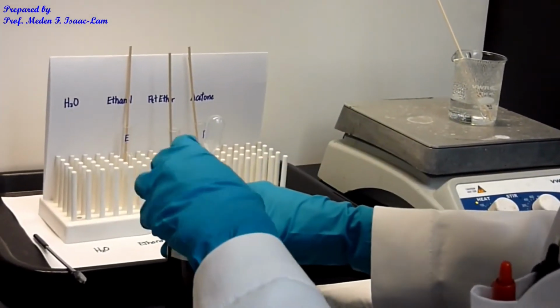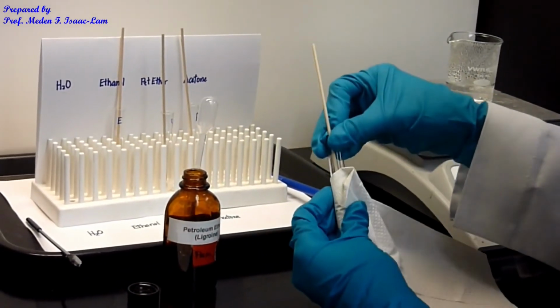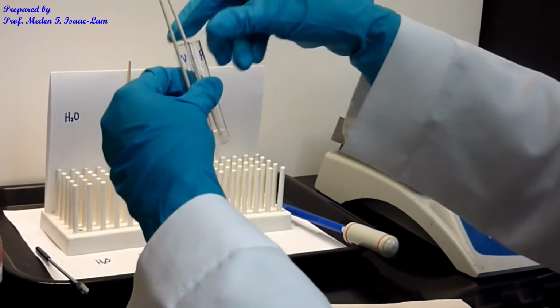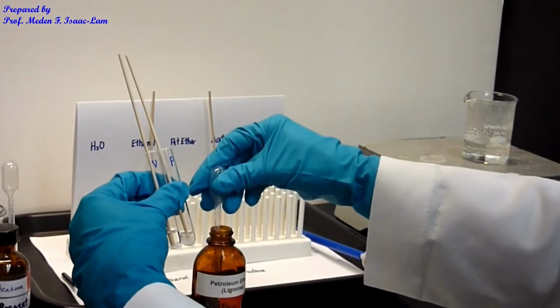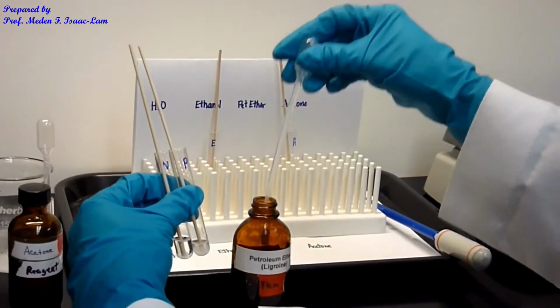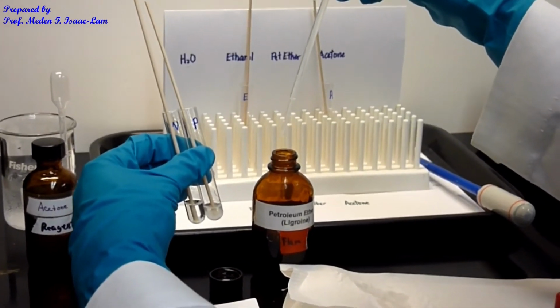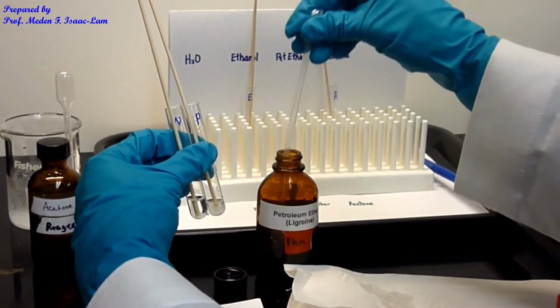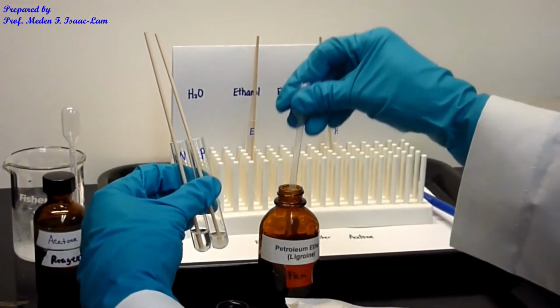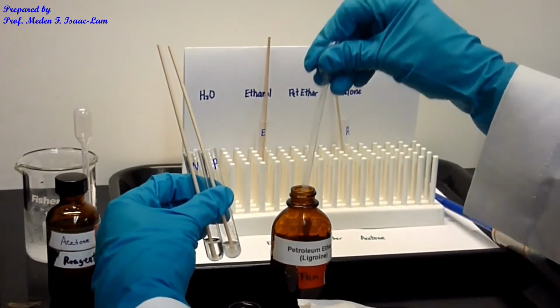So again, 10 drops. I actually wanted to make sure that I have the same amount, so I'm just gonna do that, for me to make a comparison. So this is just petroleum ether. Look, if I put up the pipette, it would drip. So one technique is to saturate it by pipetting up and down with the plastic pipette several times, and then if I can lift it, it doesn't squirt all over me.